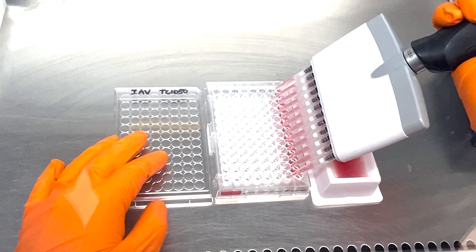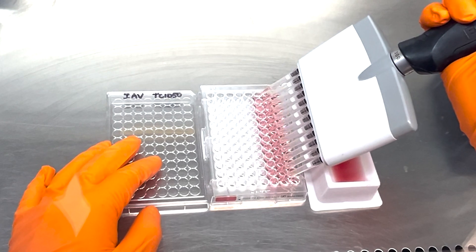But let's take a closer look at how we perform the TCID-50 assay in practice in the lab.